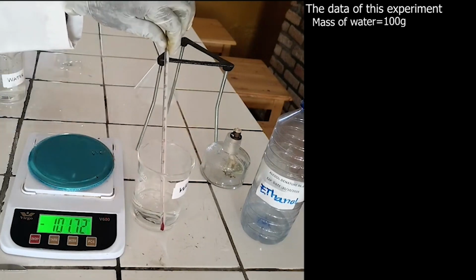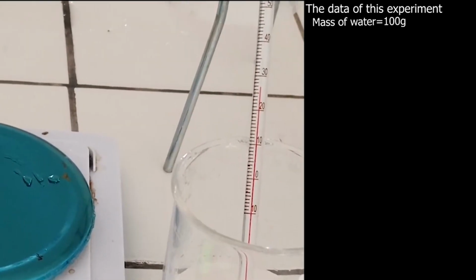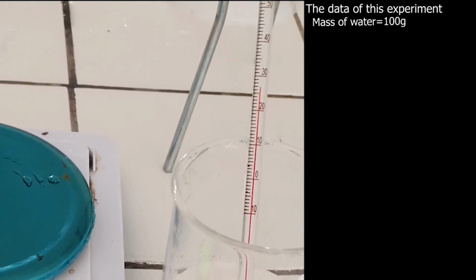Measure the initial temperature of water. The initial temperature of water is 26.8 degrees Celsius.